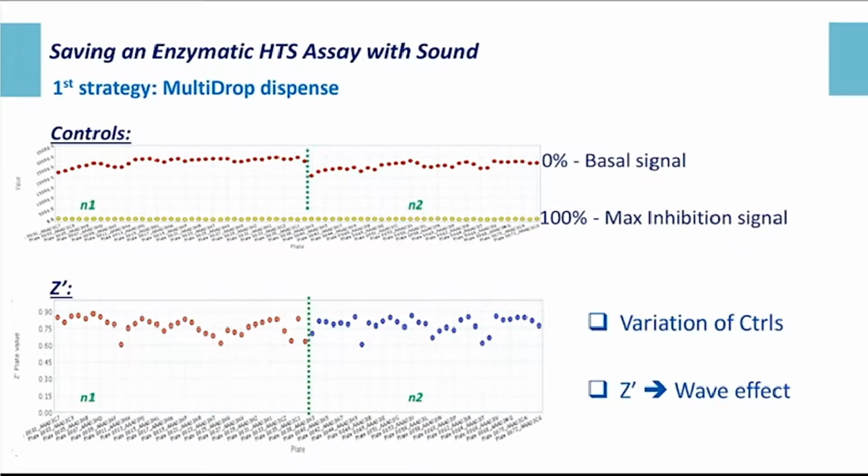In this slide, I present the monitoring of the control and the Z prime from this first pre-screen. You've got the 2 experiments, N1 on the left and N2 on the right, both made in 2 independent runs. On the top part, you've got the controls, the basal signal and the maximum inhibition signal. As you can see, there is some variability in the basal signal, with an increase of the basal signal along the time, along the plates. If we look now at the Z prime value, there are more variable values than for the controls, with a very nice wave effect. So regarding these 2 parameters, control and Z prime, we could already suspect some problem in the process.